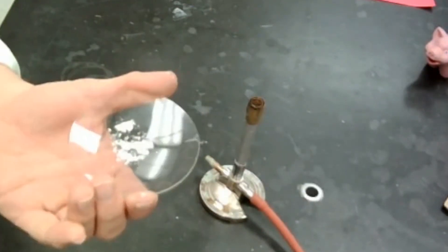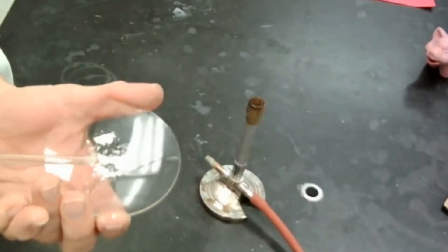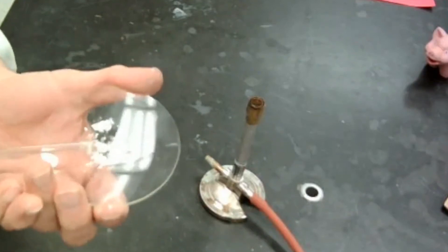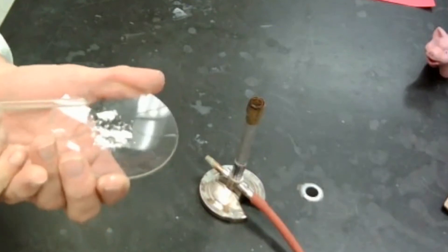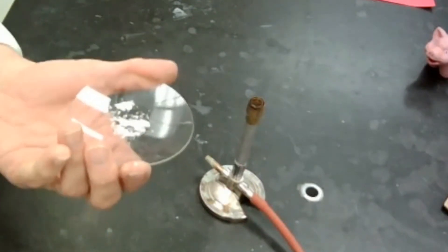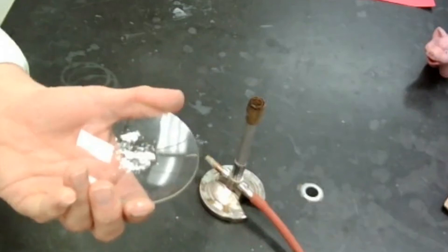So again, we have a white powder that is a solid. It's opaque. It is brittle. And it is dull. I forgot that one. It is dull. So it's not shiny, it is dull.